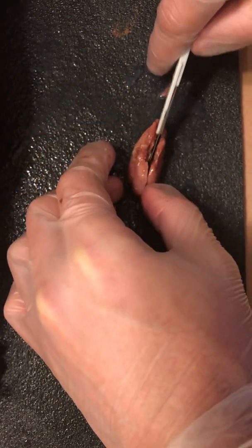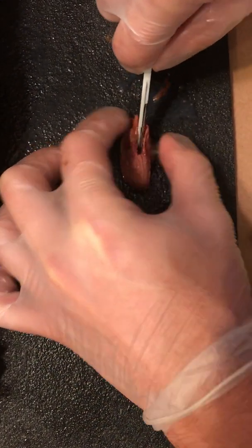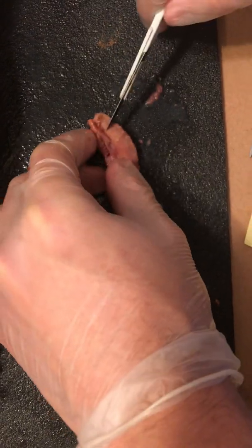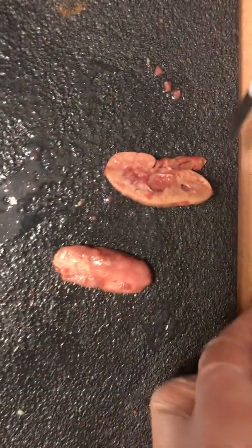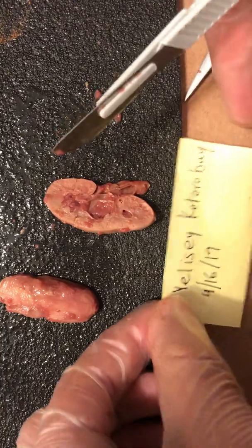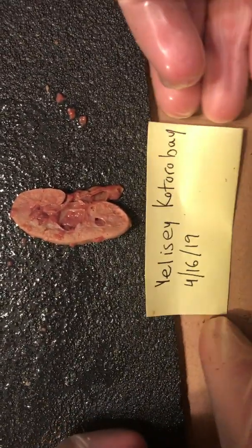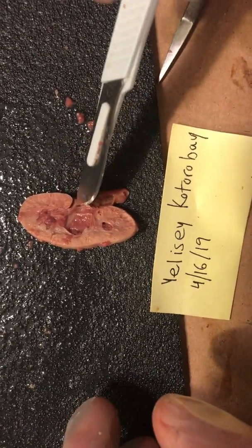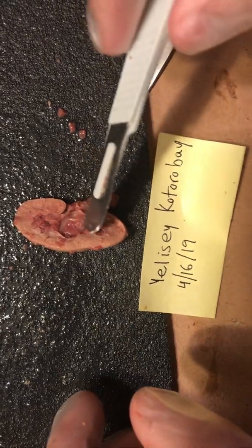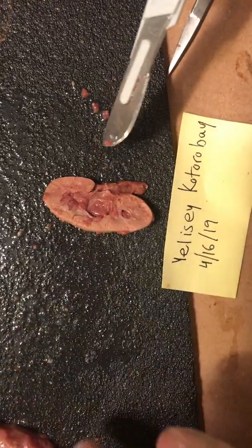Okay, a thing we should note is that, man, there we go. Perfect. That actually is not too bad. I thought it would be really, really bad, but this is not that bad. You'll note that in this view of the kidney, you can still identify a lot of the other things, like where the blood vessel would connect, but it's very, very small. A lot of the other structures look like they're developing, but you can't really identify them as easily.